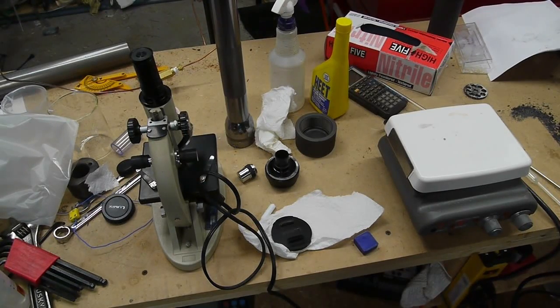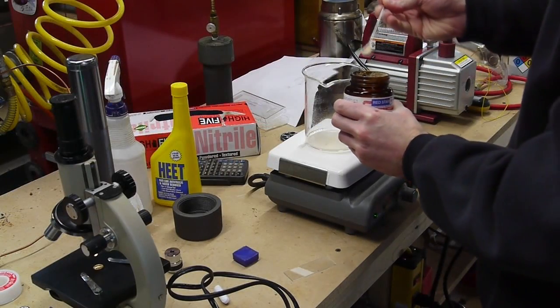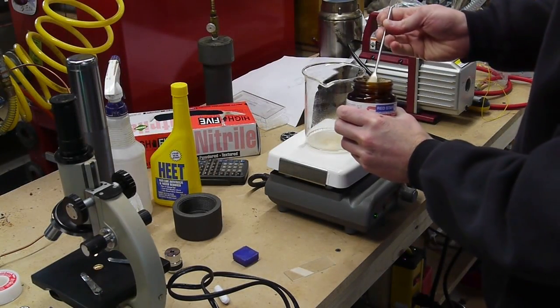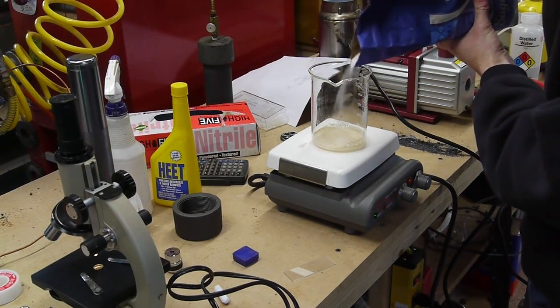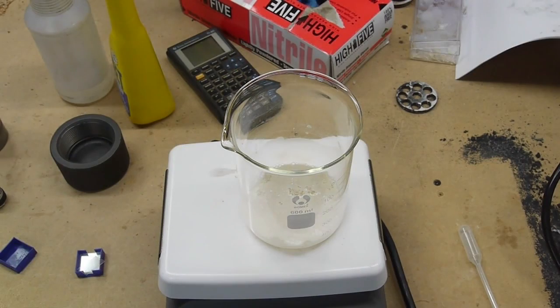I needed a photo of some yeast cells, preferably yeast cells reproducing. So I got some bread maker's yeast from the supermarket, mixed it with water and sugar in a beaker, and set the whole thing up on the hot plate at about 90 degrees Fahrenheit.